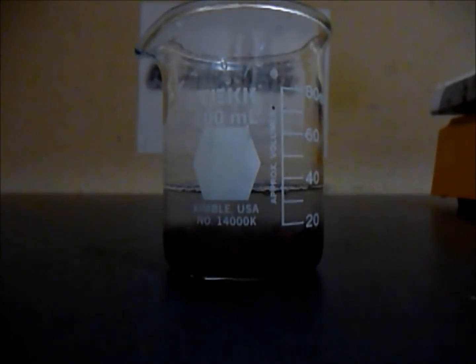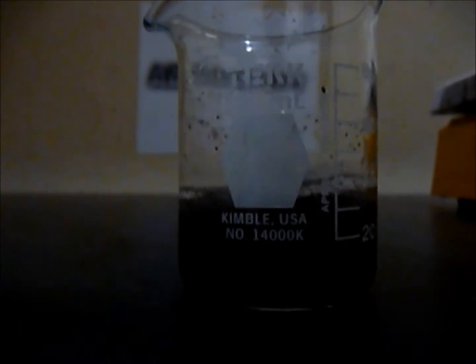It's been about three days, and this is the finished result. This is pure zinc sulfate. The next step is to filter it. Or first, just give it a shake, and then filter it.